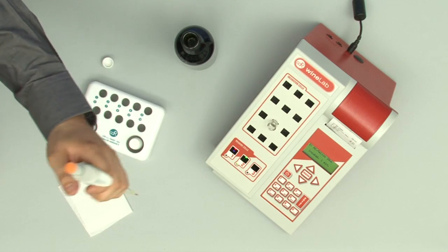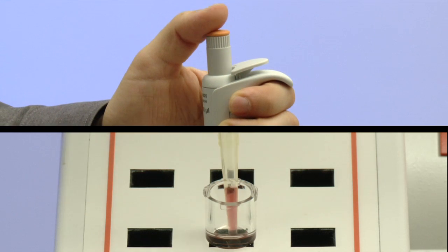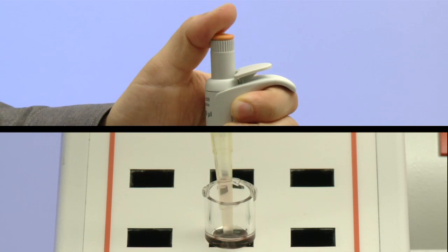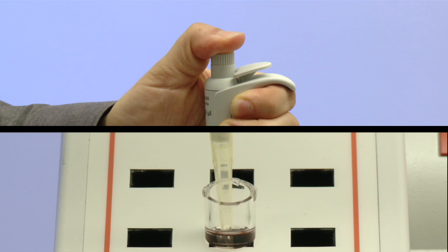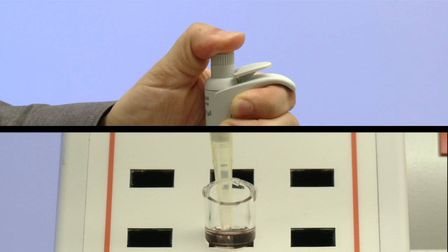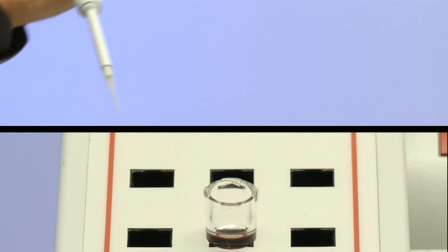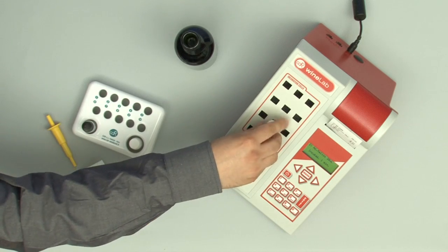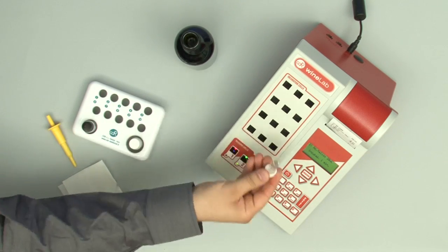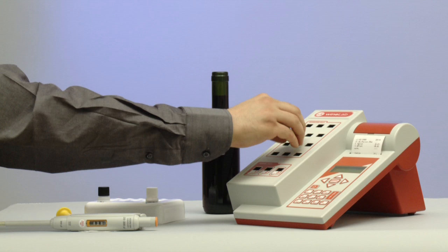Turn the pipette and gently clean the outside of the tip with clean blotting paper. Insert the tip in the liquid contained in the test tube with R1 plus R1A and pipette two to three times up to the second step to completely release the sample in the test tube. Finally, keeping the pipette button pressed, extract the tip.